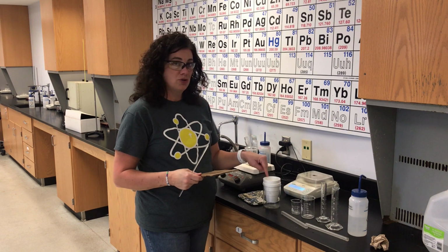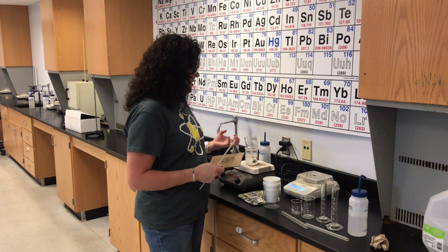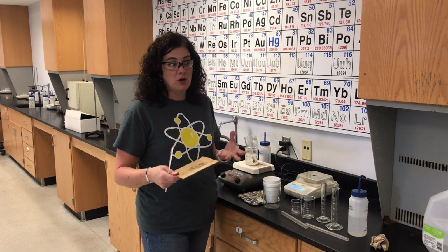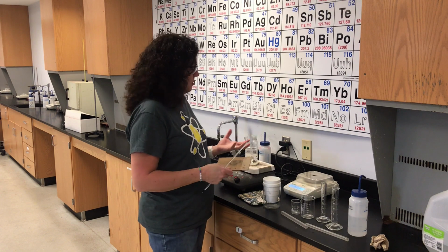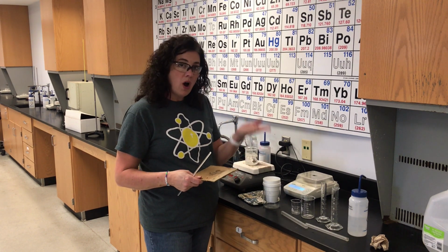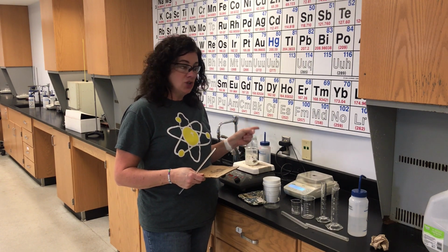Obviously, the temperature of this water is going to go up. Why is it going to go up? This metal has a certain amount of heat in it. Heat, if you'll recall, the symbol is Q. So the metal contains a certain amount of Q. When we put the hot metal into the water that has a lower temperature, the metal is going to transfer its Q to the water.